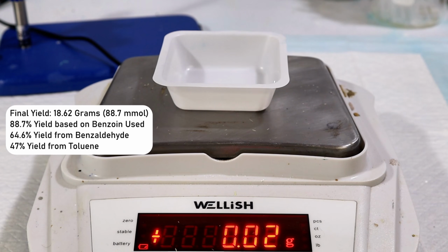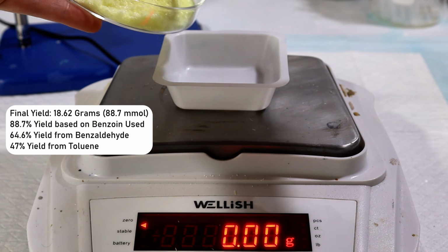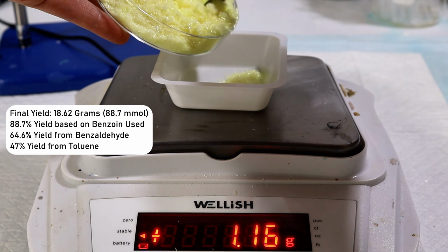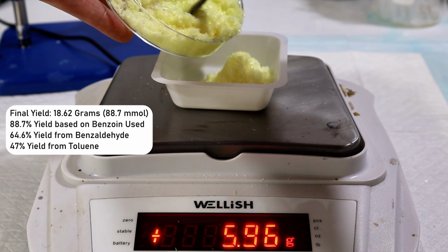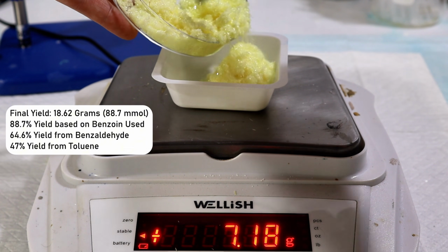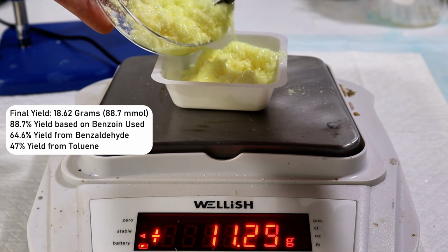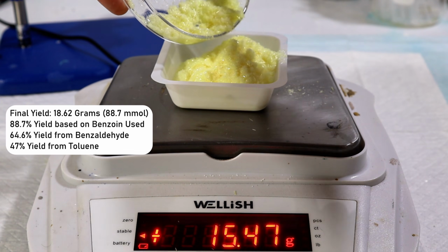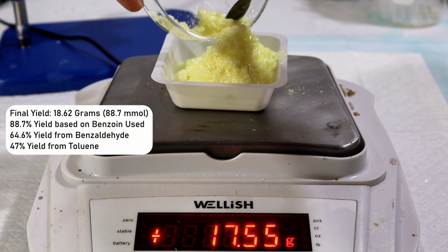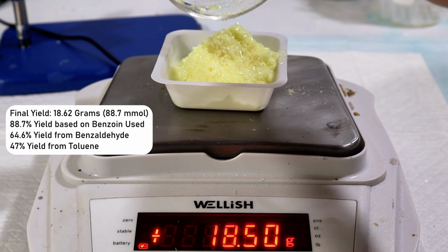However, as I mentioned earlier, it's nearly impossible to avoid a minor impurity of a small amount of unoxidized benzoin when using nitric acid as an oxidizer. This can be confirmed by dissolving a small amount of Benzil and adding a bit of sodium hydroxide. If any unreacted benzoin is present, the mixture will turn purple like you'll see in a moment. However, the overall yield is a lot higher using nitric acid compared with the other methods I reviewed, and so I think it's worth the minor impurity.